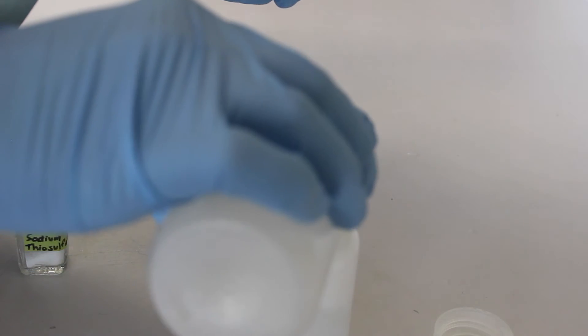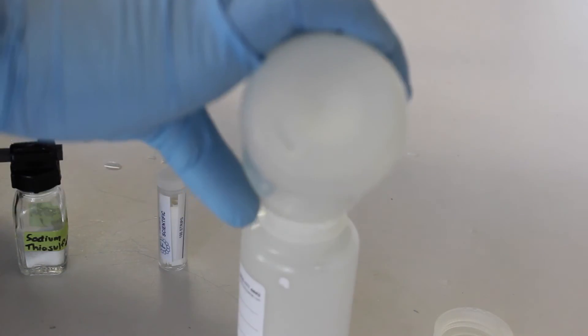Make sure to include the amount of sodium thiosulfate used on the chain of custody and indicate whether or not chlorine was present.